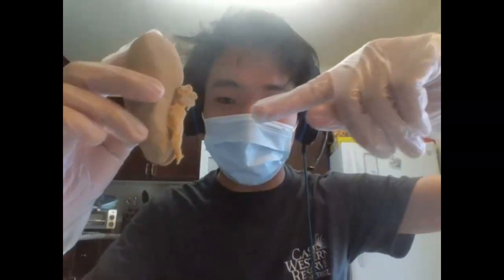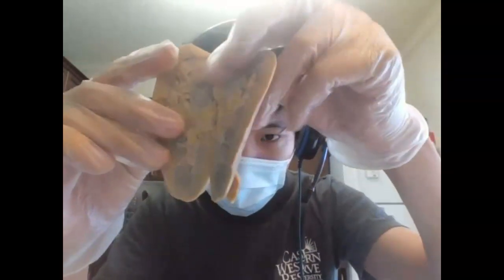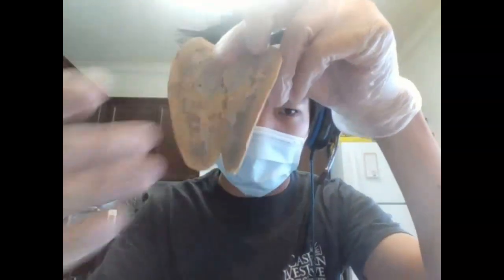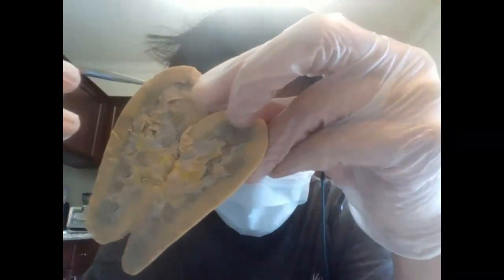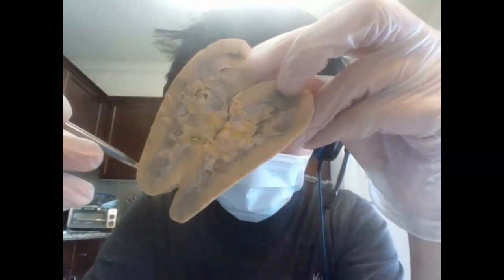Okay, so let's go on this journey of our fluid. The journey begins, well, actually, it begins in the kidney at the renal artery. Now, the renal artery runs through the periphery of this kidney. Here you'll see multiple things, right? Let me get this device right here to point things out. The more flesh-colored peripheral section of the kidney is the renal cortex.